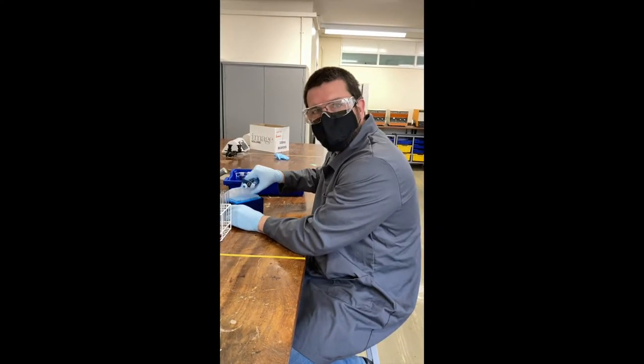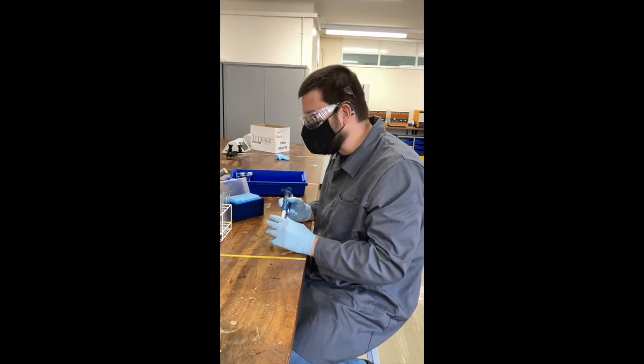Okay guys, what we're going to do today is show you how to create a standard curve. I'm going to show you two methods to do this.